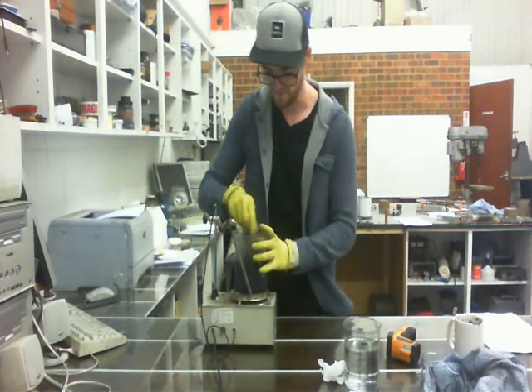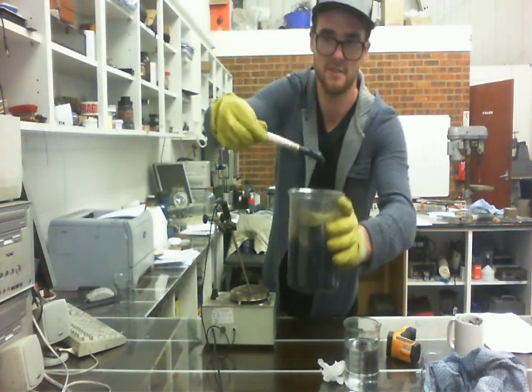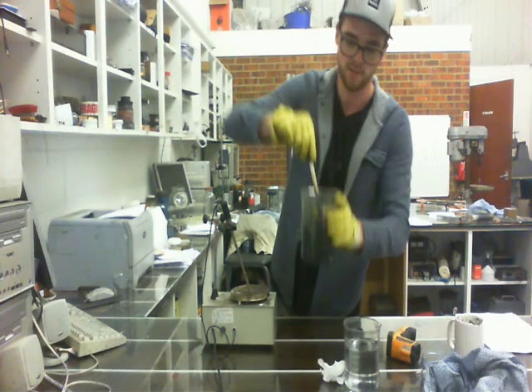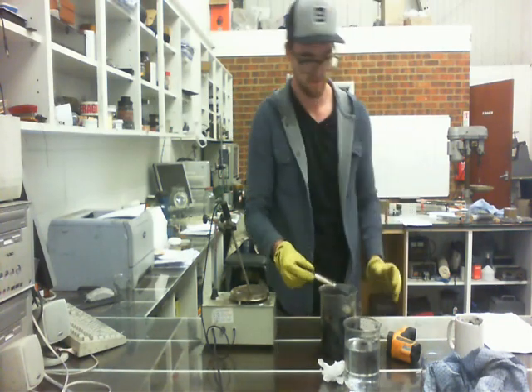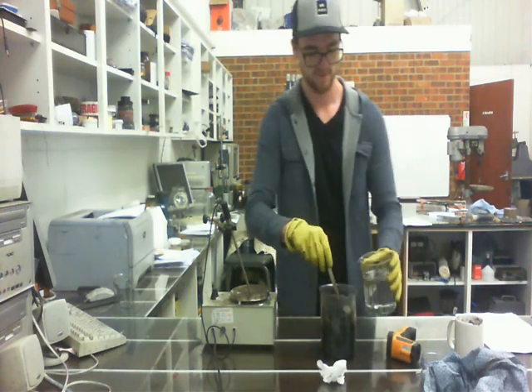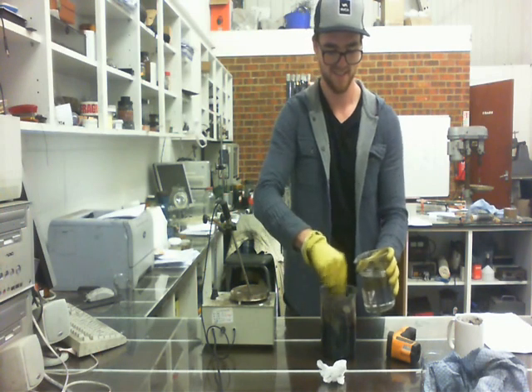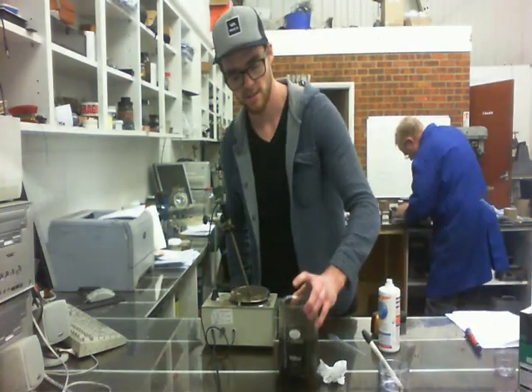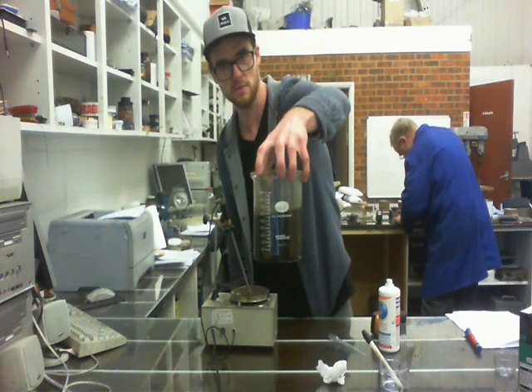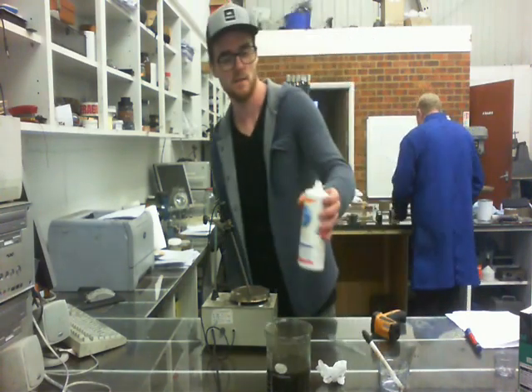It's been about a half an hour stirring it on the heater, and it's gotten pretty thick. You'll see the grayish-purple color. Now we're going to add the deionized water, just a little bit at a time. After heating it at 98 degrees for 15 minutes, this is what we've got — it's a lot more liquid than before; it's not that thick gunk anymore.